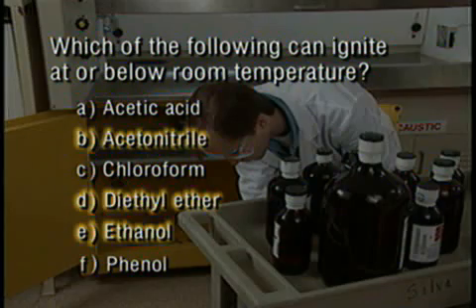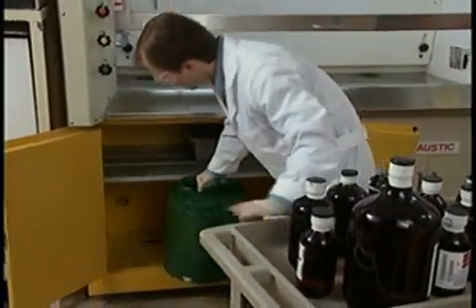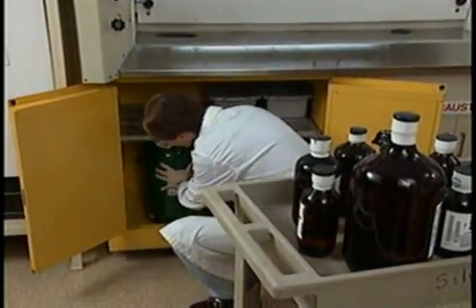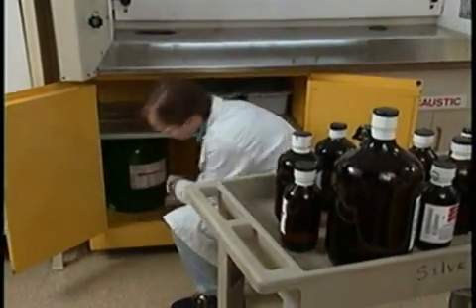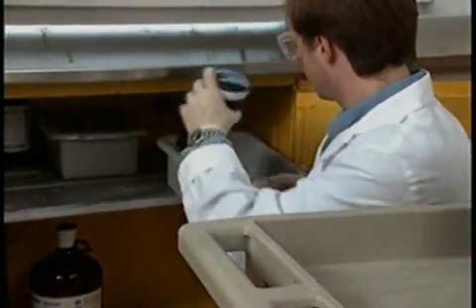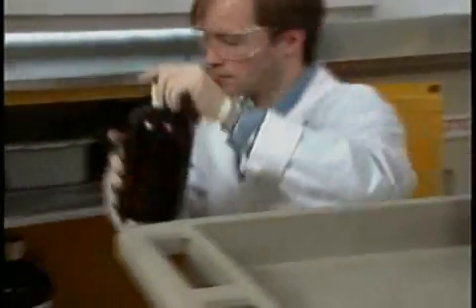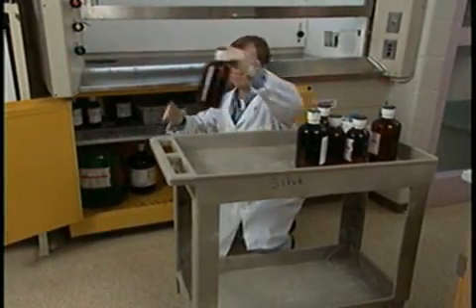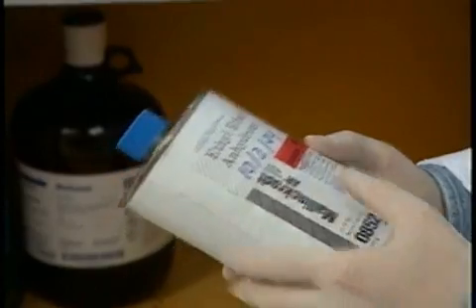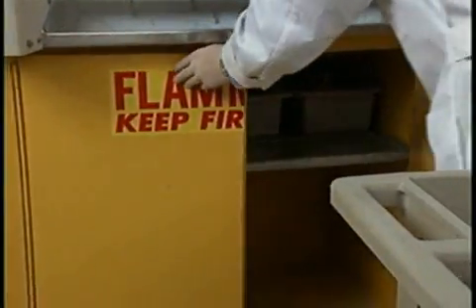These chemicals belong in the flammables cabinet. Larger quantities — say above 4 liters — should be in a metal container or, better still, a safety can. You can store organic acids and organic bases with the flammables, but carefully separating them. There are formal limits on the quantities of flammables you may store. If there's any question, your safety officer has the answer.